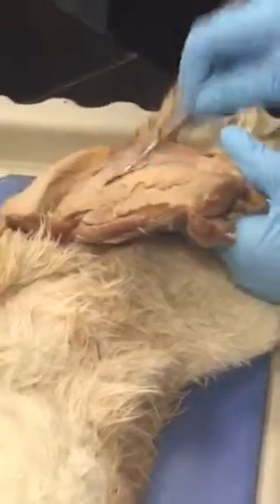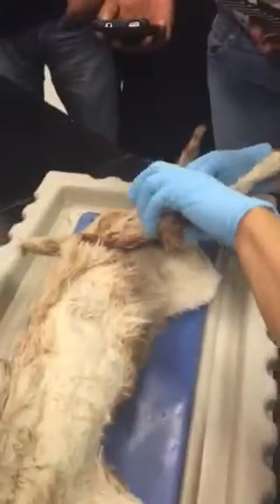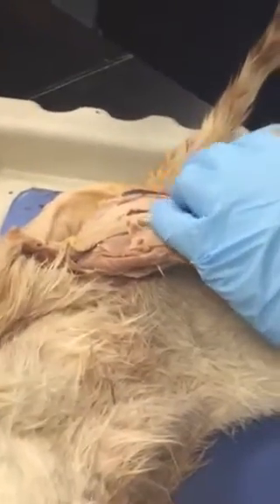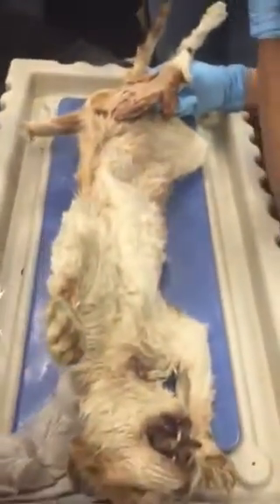Okay, so this is biceps femoris. And again, what is the other muscle together with that, even though the size is different in humans? Semimembranosus? Semitendinosus in humans. Sorry, I forgot your name. Raul, right? Joel. Oh my God, sorry.